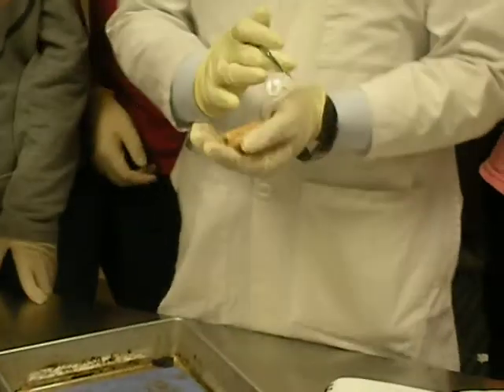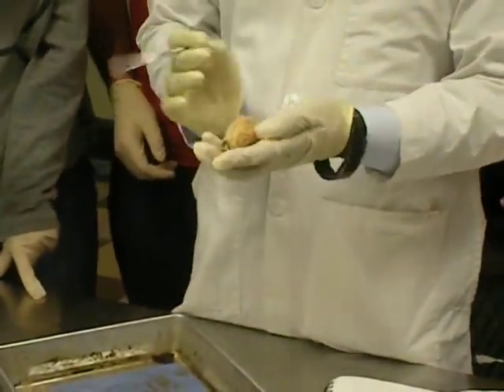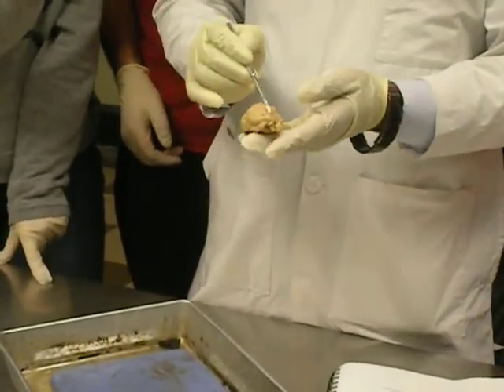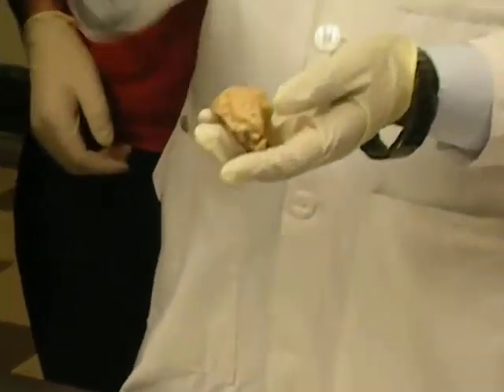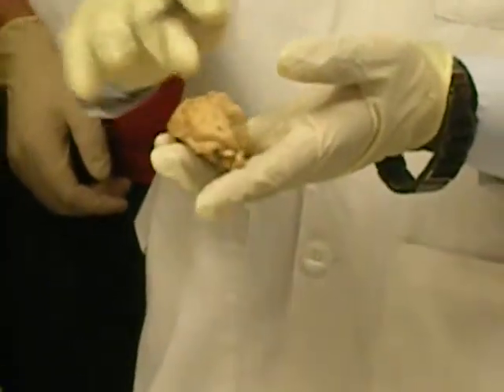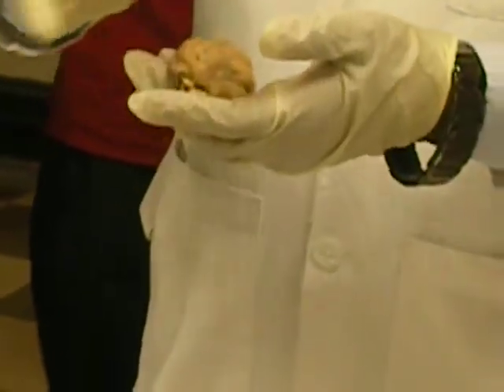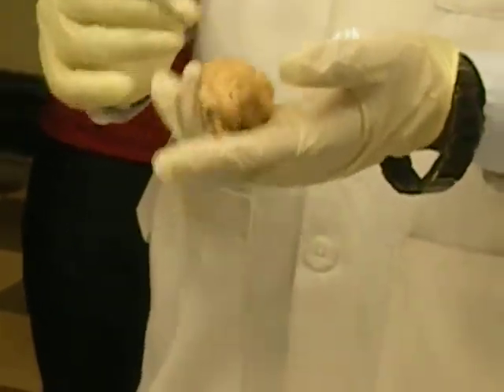This is called a hemisection because you are seeing only half of this thing, alright? Half of this thing. And what else can you see? You can see one covering over there, and already you know most probably this is the pia mater we are talking about, alright? This is the innermost layer of the meninges, holding or covering the brain and spinal cord.